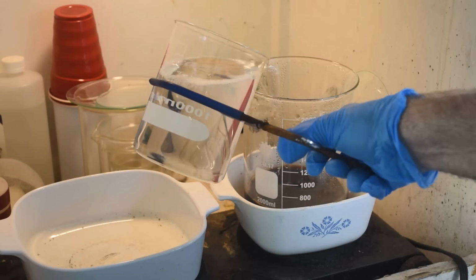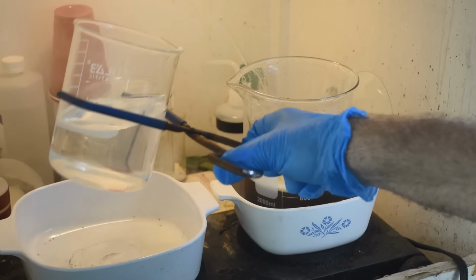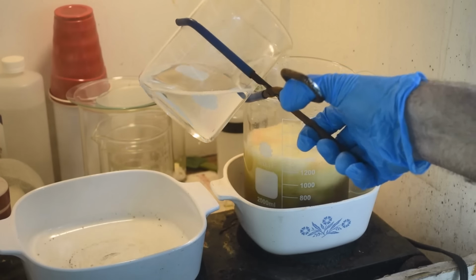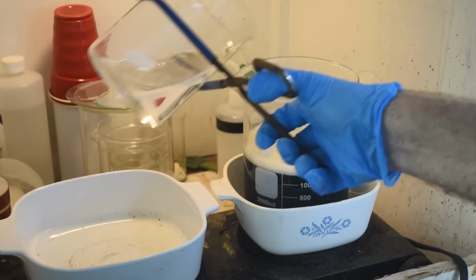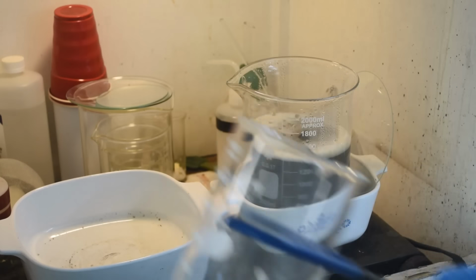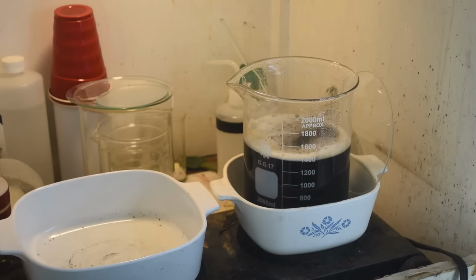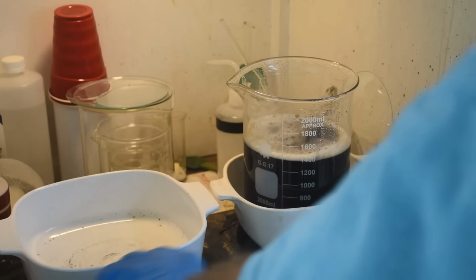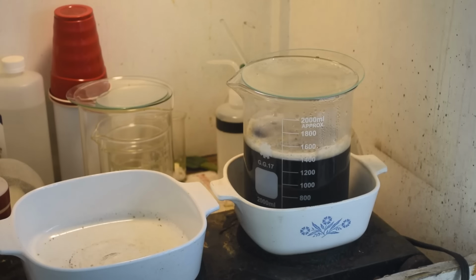All right, here we go. Oh yeah, a little bit of action there, huh? Okay. So Hope wasn't lying. There can be a fairly energetic reaction there, but the colors changed. That's nice. In fact, they went kind of through the rainbow. Started out kind of reddish yellow and went a little green, and now it's gone dark gray. All right, we'll let this sit here and boil, just like the last one, and see what we get.